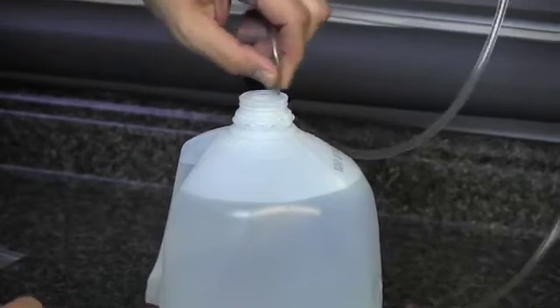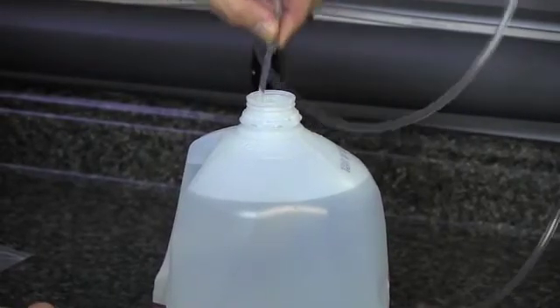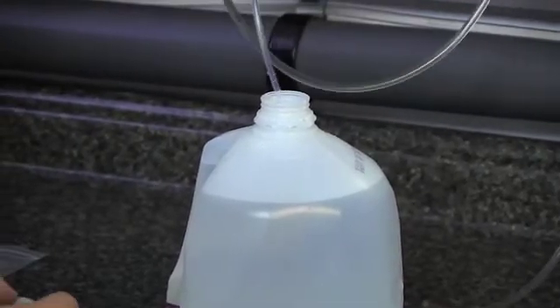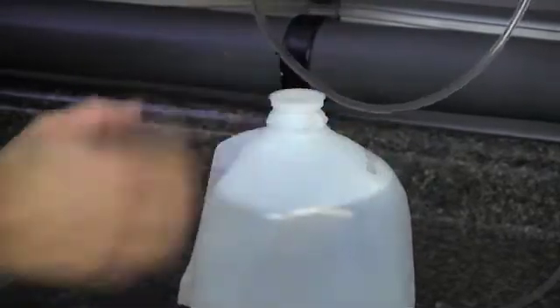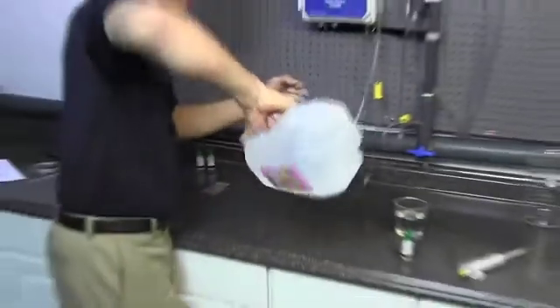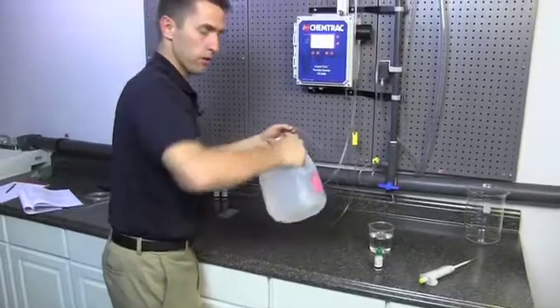Now we'll just kind of gently swirl around the tubing just to make sure we get the spheres off the tubing. Then we can remove that from the jug and just gently invert the jug a few times just to kind of help mix up the two micron spheres.